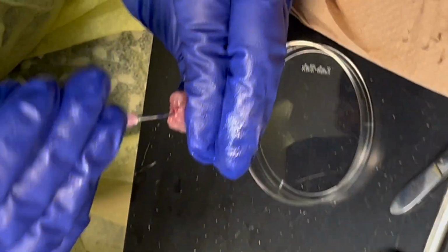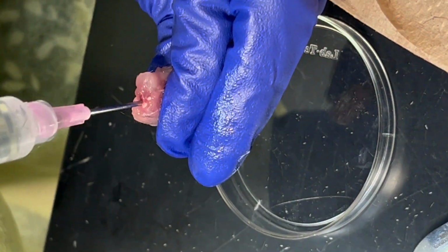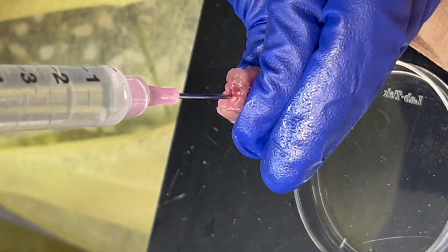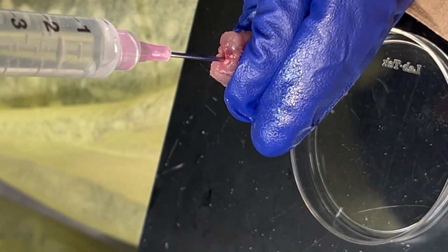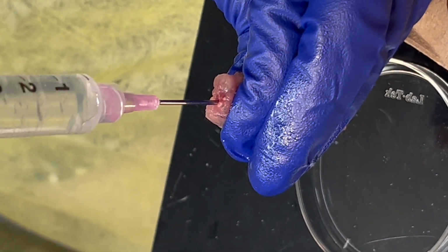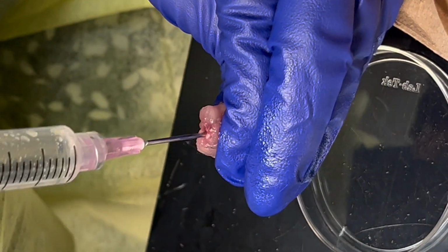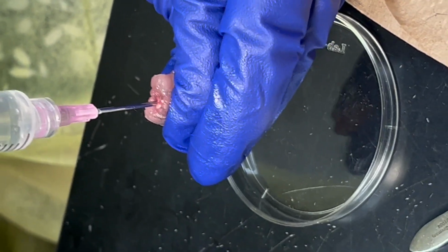So then I should feel some pressure. If I don't, that's bad news, because I cut too far. Essentially, when there's a big hole, you've already gone through so much that there is no pressure to build. You literally made extra space next to the spinal cord with this needle, so extra tissue comes out. That's when it's hard, but I'm gonna try anyway.